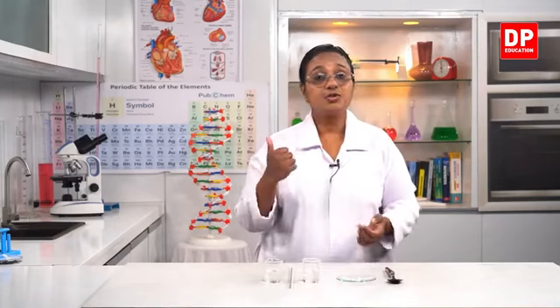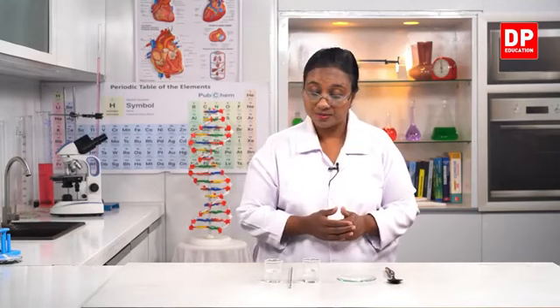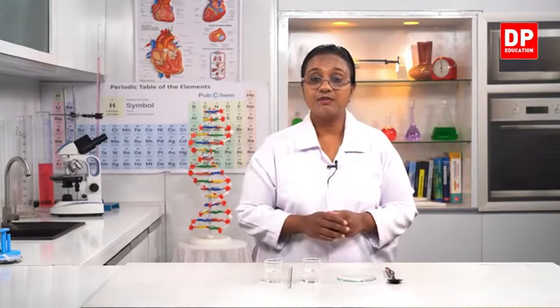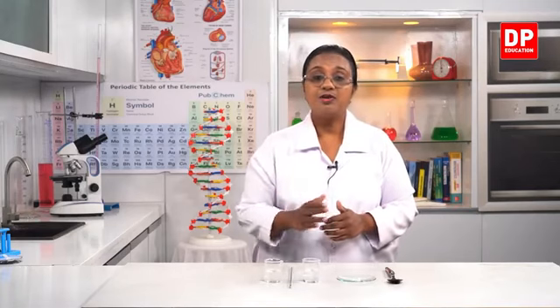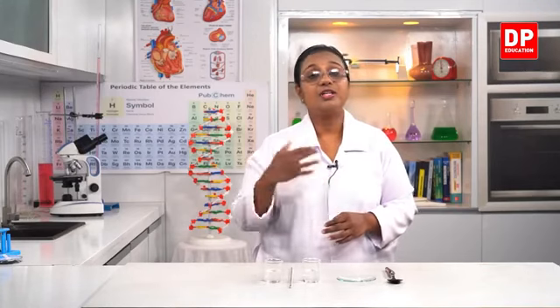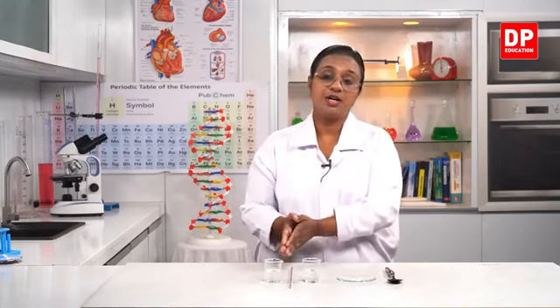So, there again, you saw the dissolving of the initial substance in the dilute sulfuric acid solution and you were able to observe an increase in temperature. Then the last one, I showed you the reaction of magnesium with again dilute sulfuric acid. You saw the magnesium strip completely dissolved. At the same time, you were able to see the liberation of hydrogen gas. So, in that also, initially we took dilute sulfuric acid and magnesium. Finally, you only have a clear solution and you saw the liberation of gas. So, those were the final components that were produced.